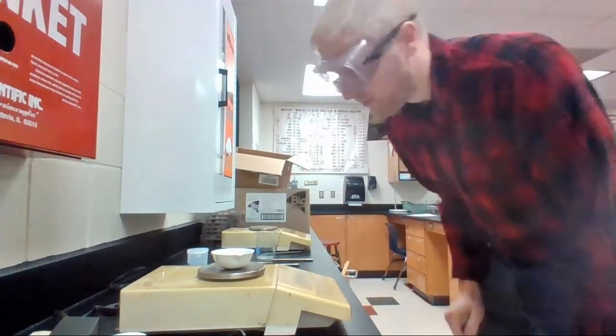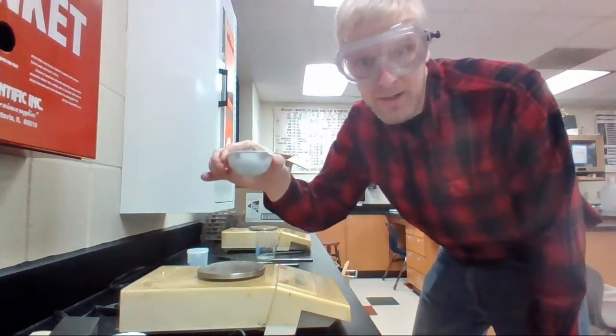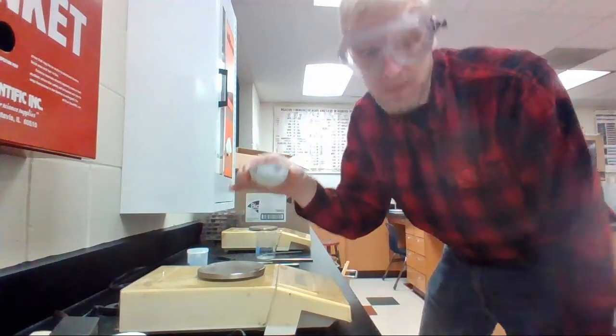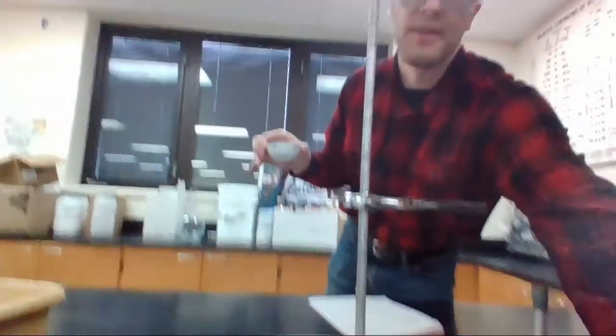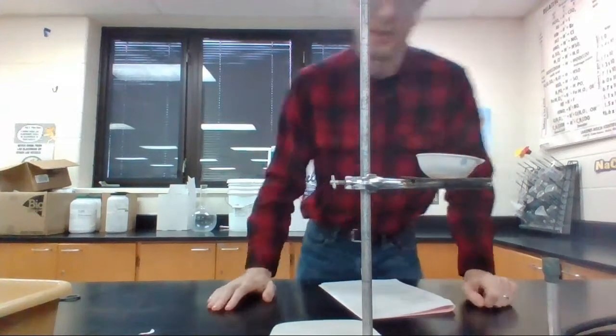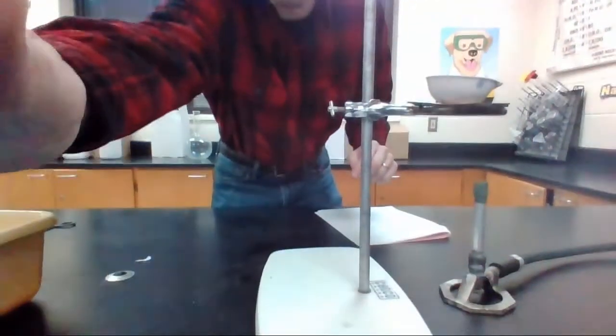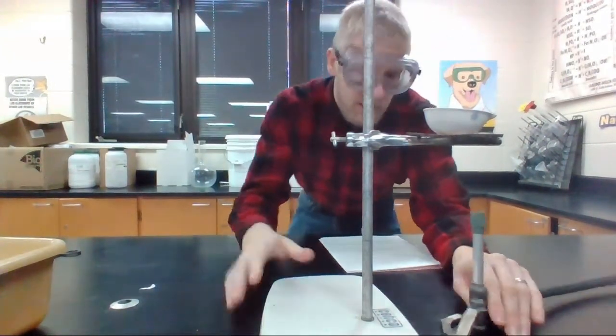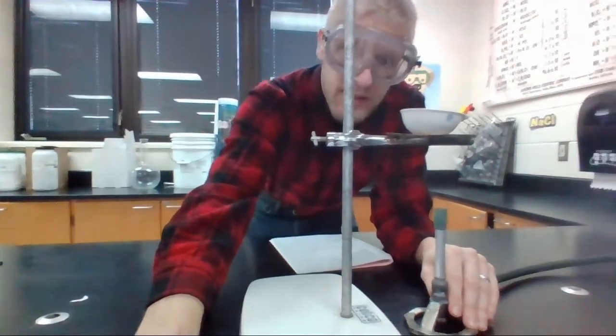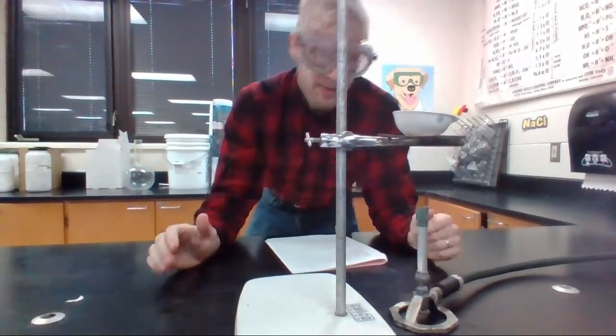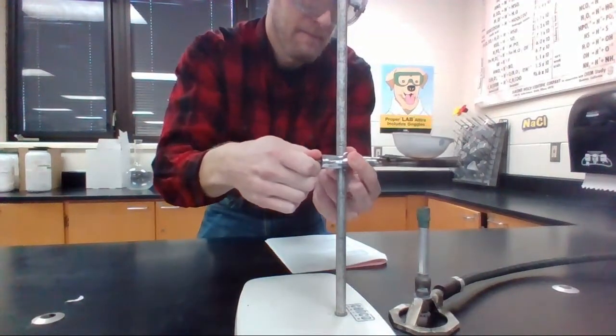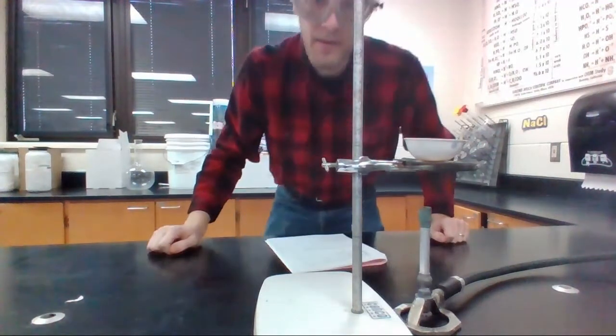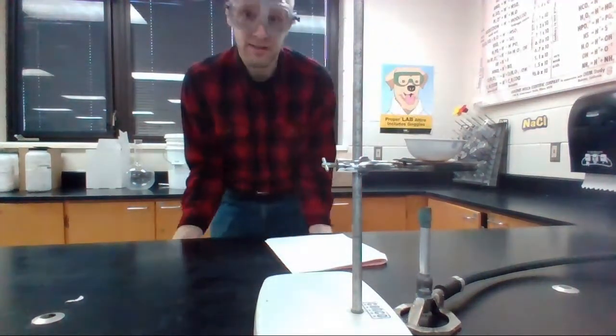Back to the experiment. We're going to take the hydrate in the dish and we're going to start heating it on the Bunsen burner. This is a nice little experiment setup. Putting it right on the dish. And let's get this down a little bit so we can see it. Move this ever so slightly. And here's our setup. I'm actually going to lower this a little bit.